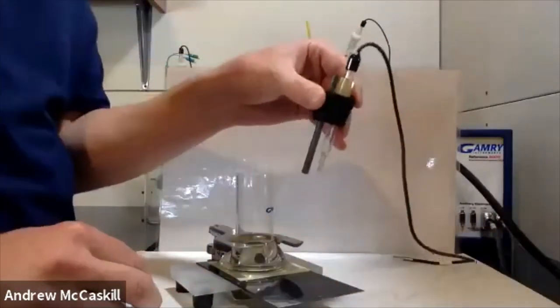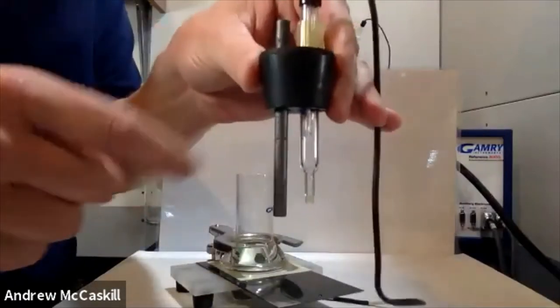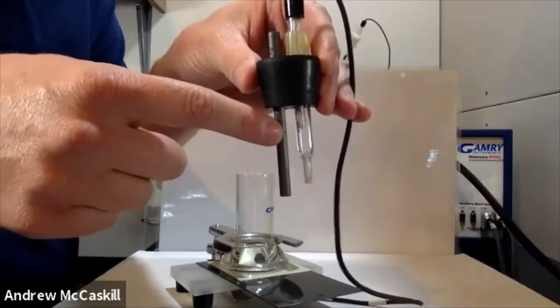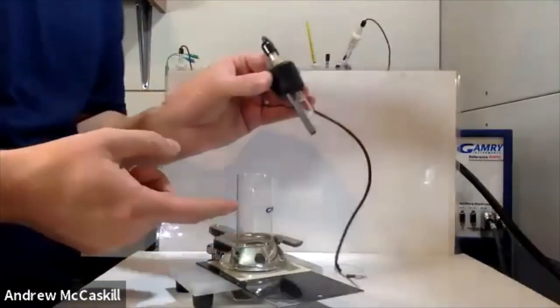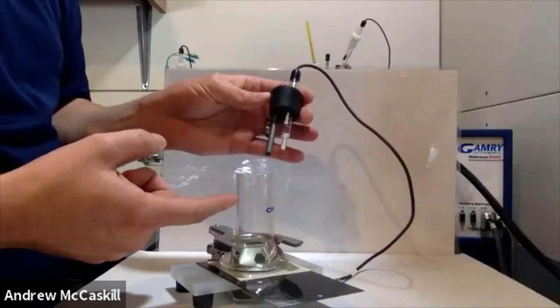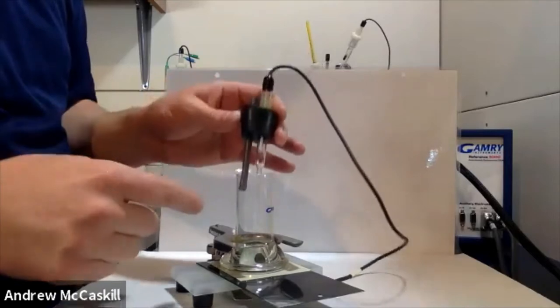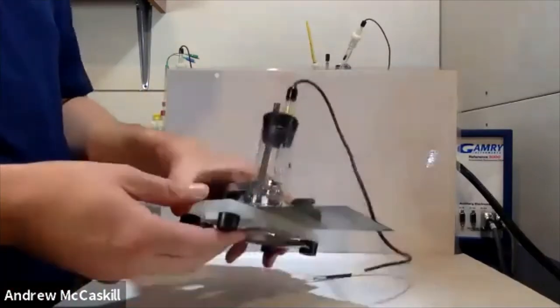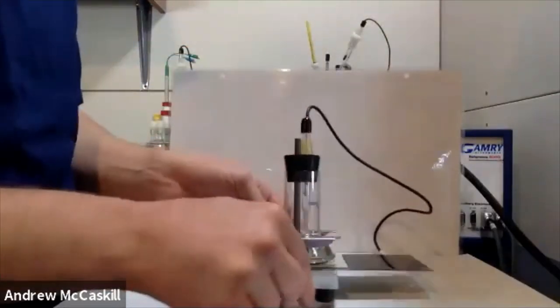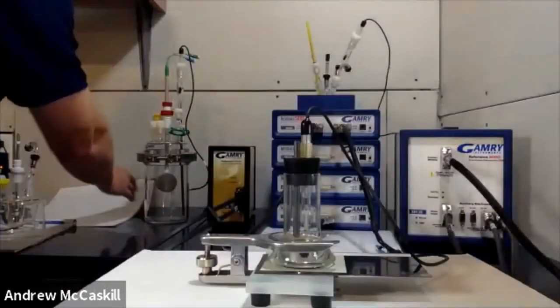There's our working electrode. It's nice to have this stopper here that holds the reference electrode. This is our calomel reference electrode and a graphite rod as the counter electrode. We can fill up the volume anywhere from about 20 to 50 milliliters of solution — just make sure you have enough to contact the tip of the reference electrode and immerse the counter electrode. It fits in like so, and there's your simple three-electrode cell for a flat or coated specimen.